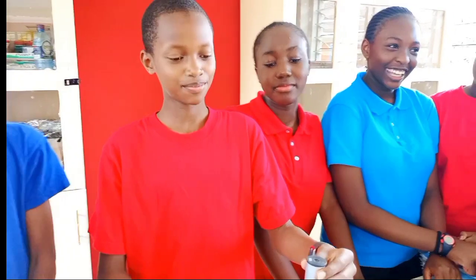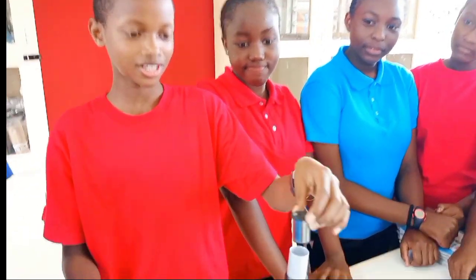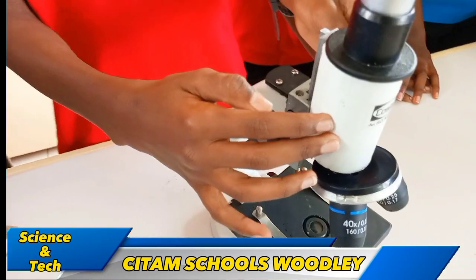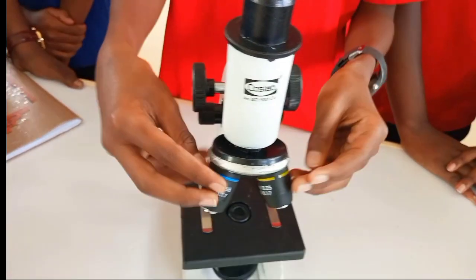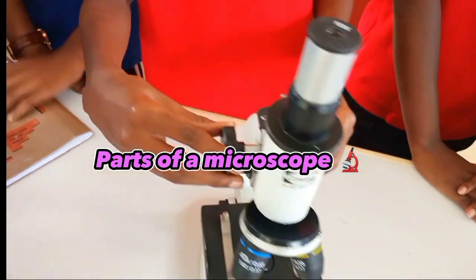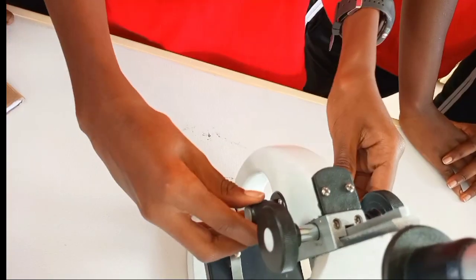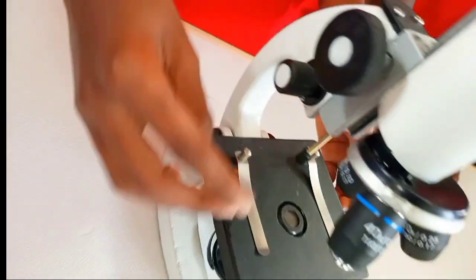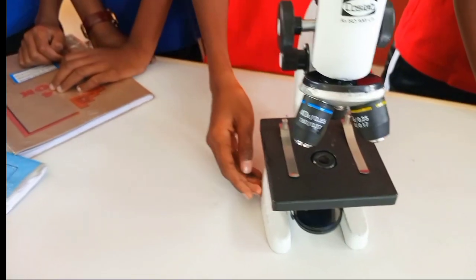The first part is the eyepiece, and it's removable. The second part is the body tube. It holds the nosepiece, which has the objective lenses. This is the coarse adjustment knob. This part here is the fine adjustment knob. This is the stage. This is the base.